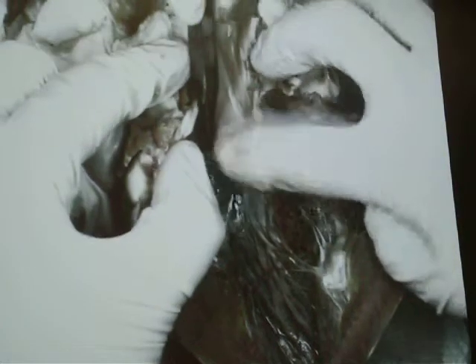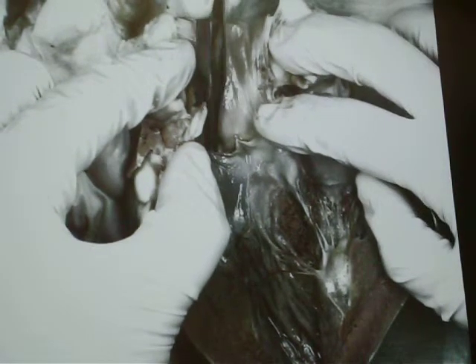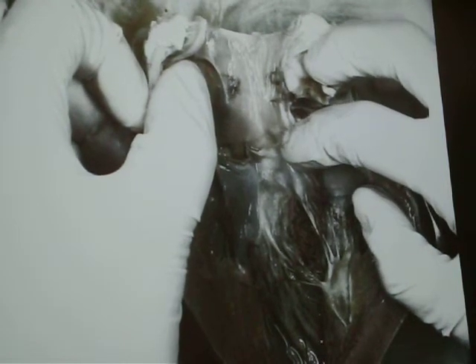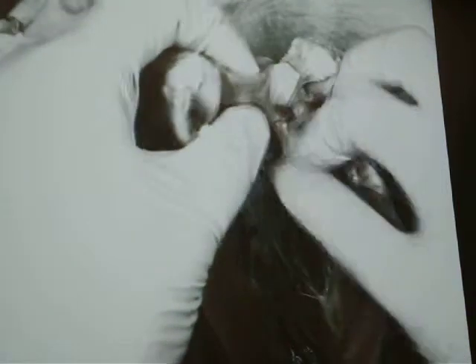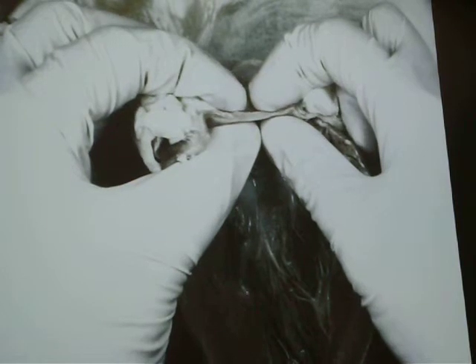You can also see that nice little hole down here, and that's the entrance to one of the coronary arteries — I believe it's the right one. You can note that the aorta itself is a slightly different color, almost a yellowish tint to it. That would be from the yellow elastic connective tissue fibers that help to make it up. Look how thick that wall is — the aorta is very thick.